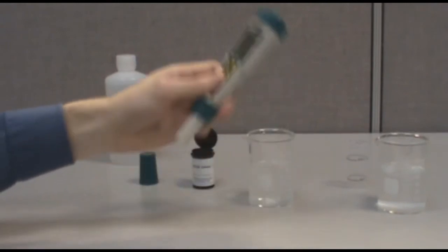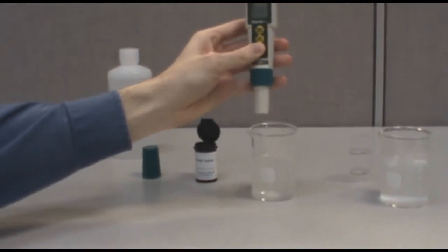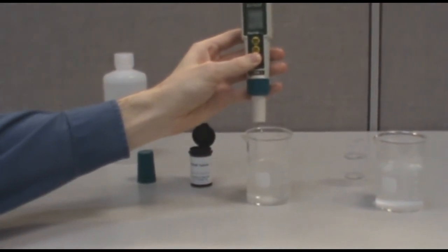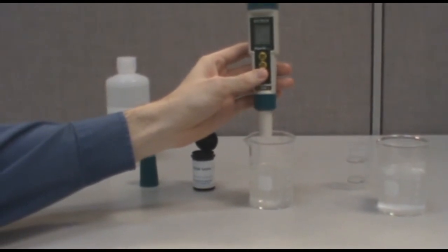Then place the meter in your prepared sample solution. The value of your sample will appear on the display of the meter. It may take a moment for the reading to stabilize.